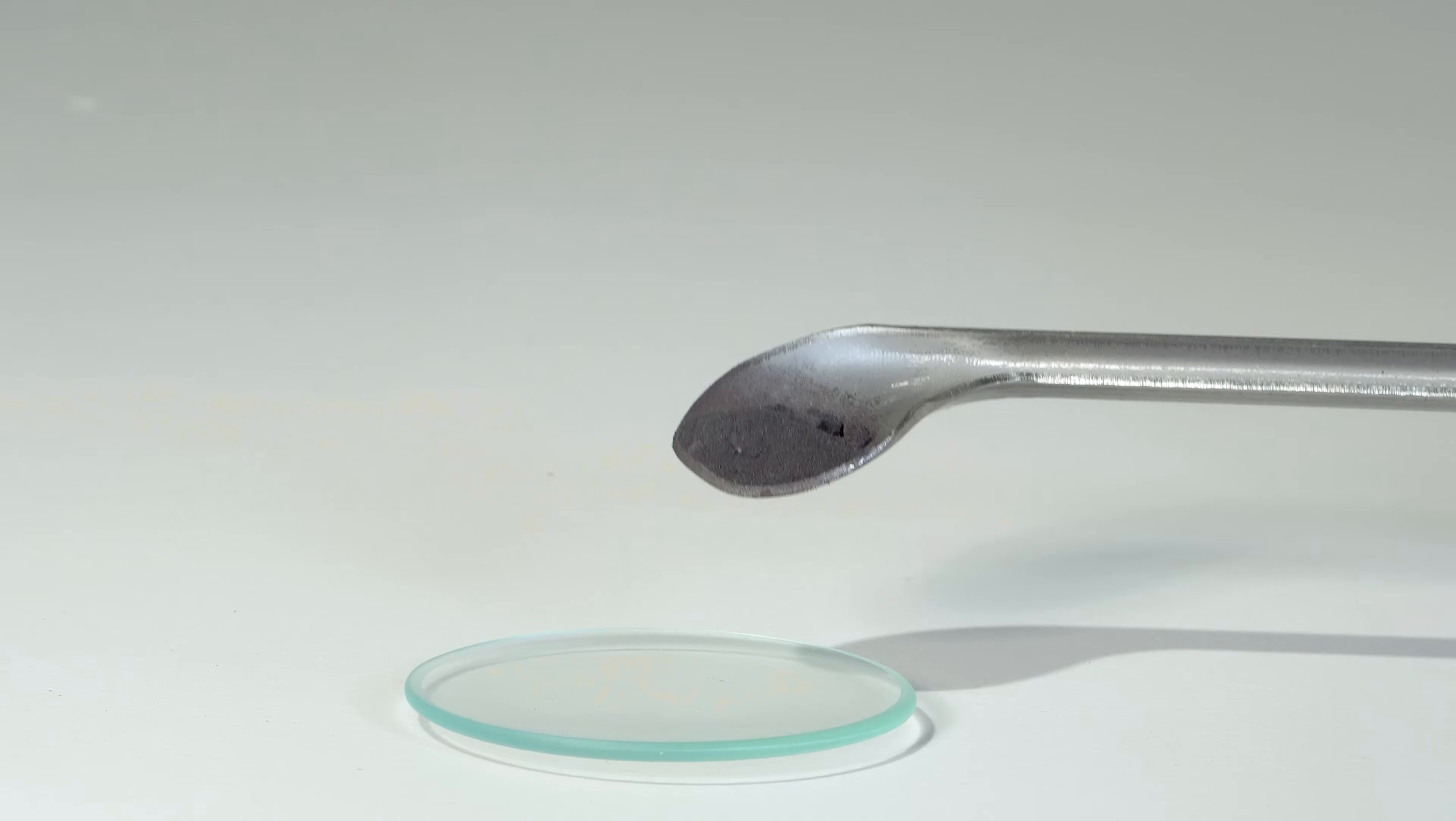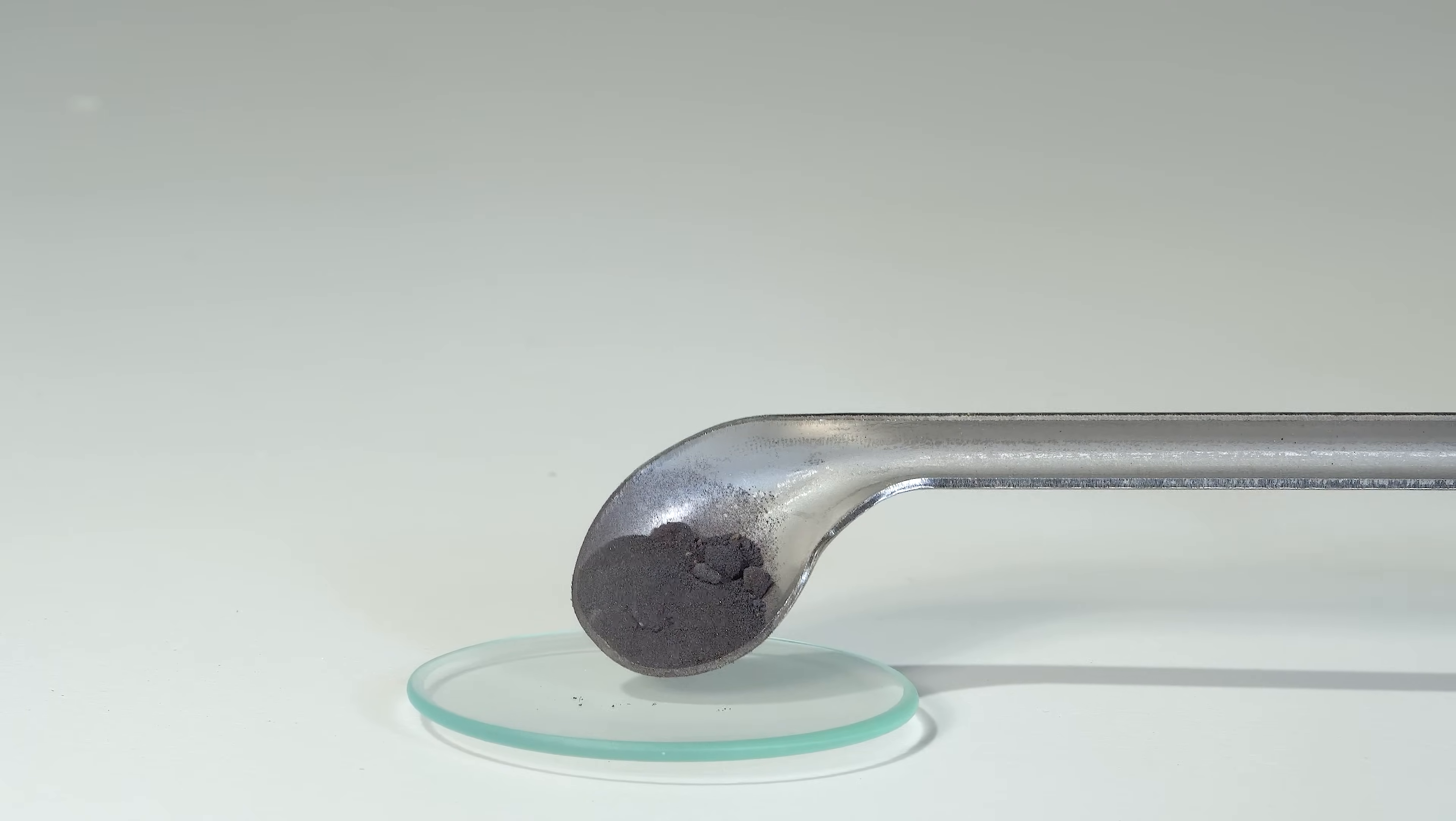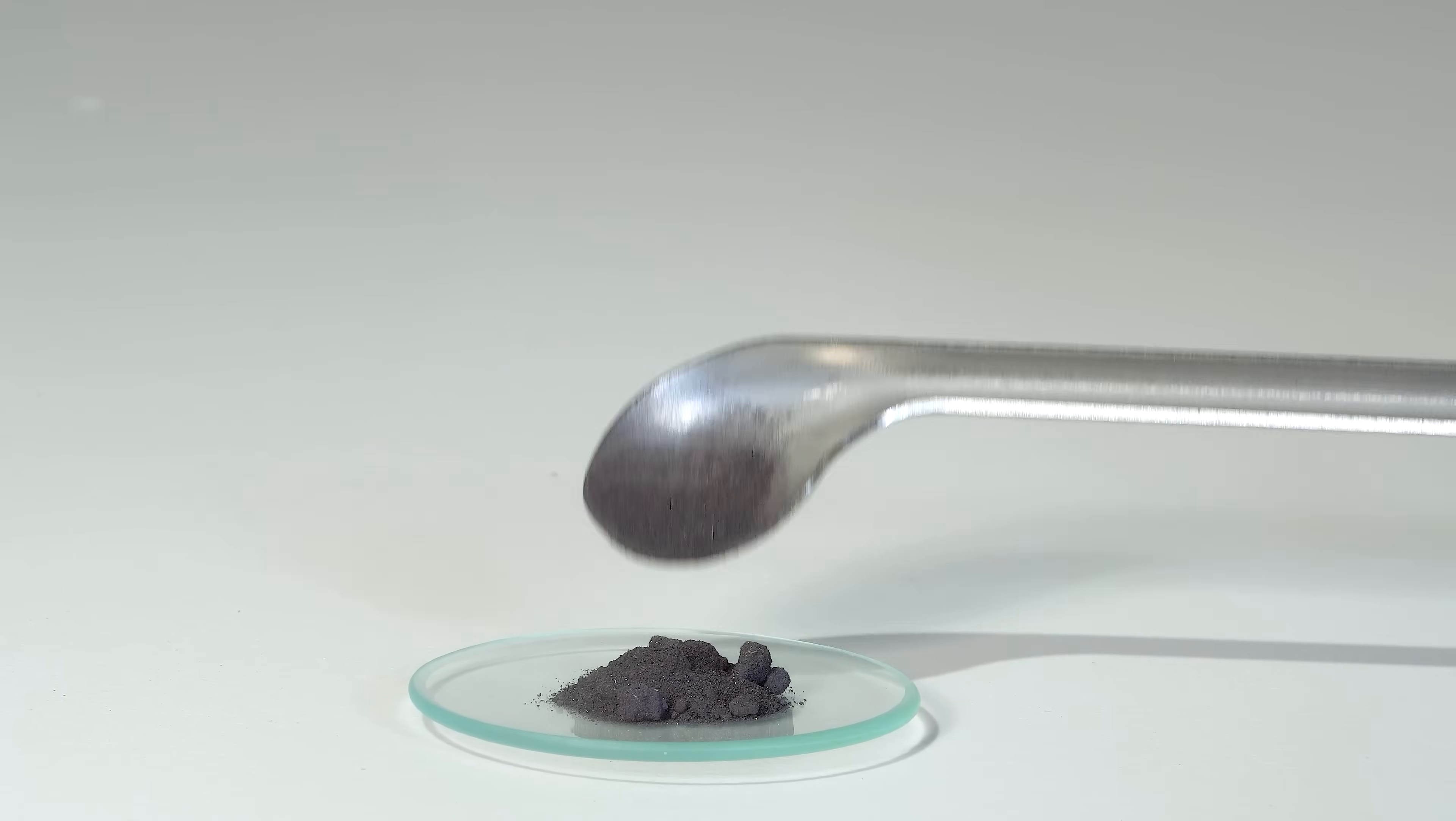Tungsten hexachloride reacts explosively and ignites upon contact with anhydrous hydrazine.